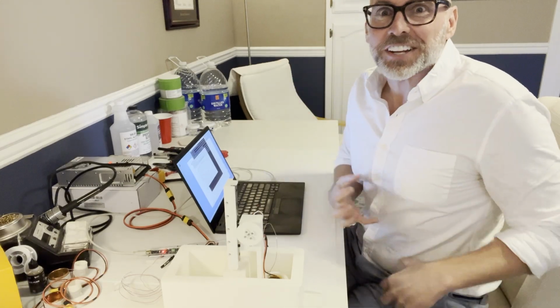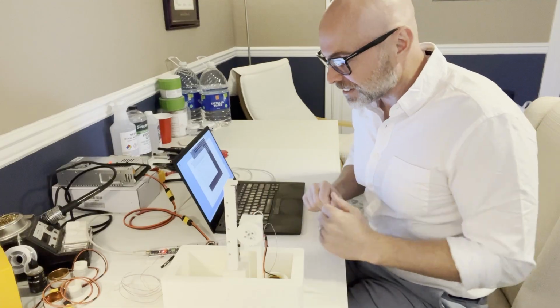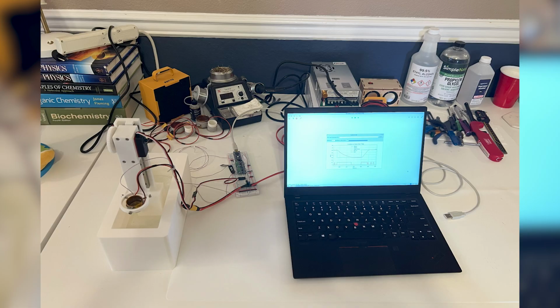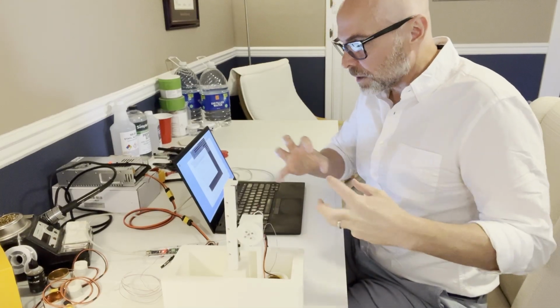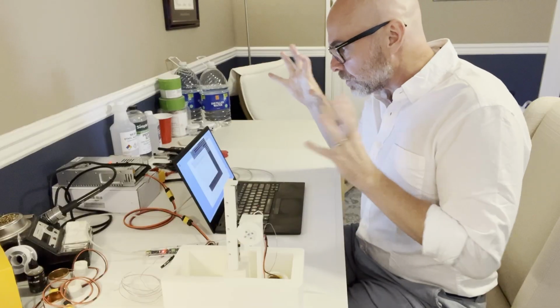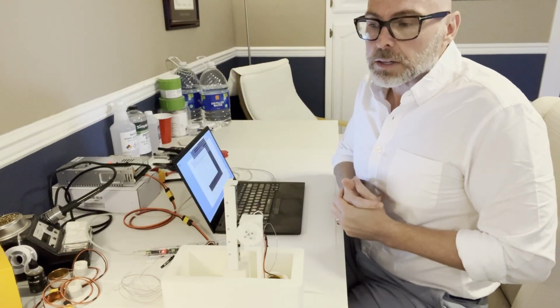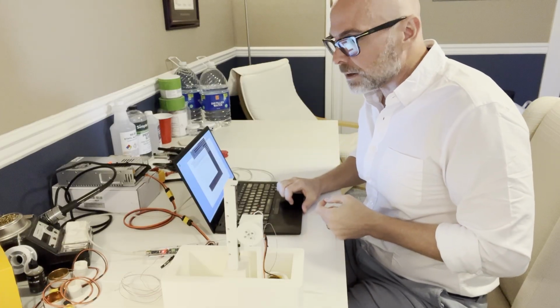This was a massive project. It felt like a massive project the past couple weeks, but now I'm going to go get out some more liquid nitrogen, and then I'll collect that data. But all the code is set up and the hardware. I can't wait to come back around to this because I want to improve all this setup. I have other ideas for a different device and whatnot, but I think I'll try to get through the full cryopreservation, or at least some experiments, before I start improving on this stuff. Okay, that was it.